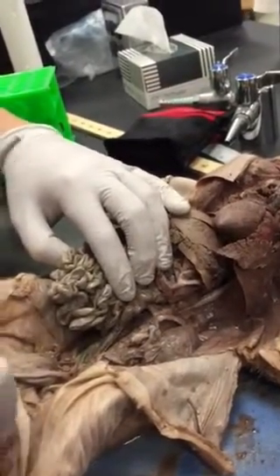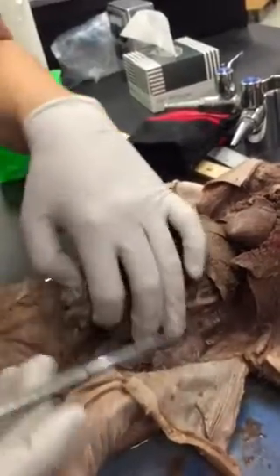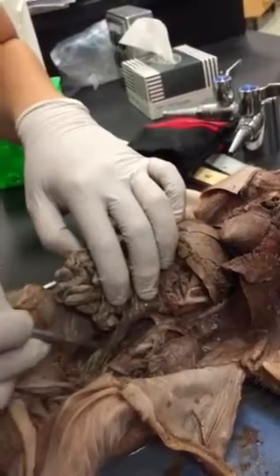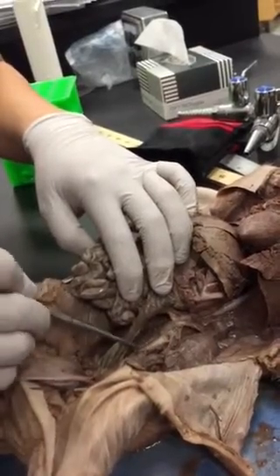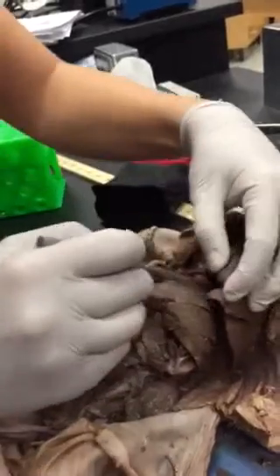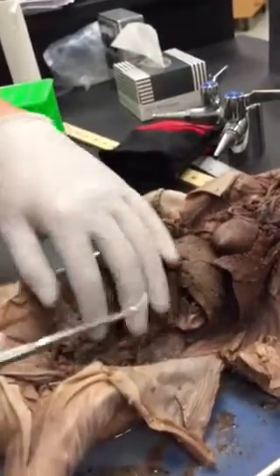Renal veins. They're renal veins, exactly. So very easy. They're all named depending on where they're going, okay? And you can follow these back, and you see that these veins are coming off of this guy. What do you guys think this is? This big blue thing back here. The iliac? No. Remember what came right out of here? The inferior vena cava. That's running all the way through here, okay?